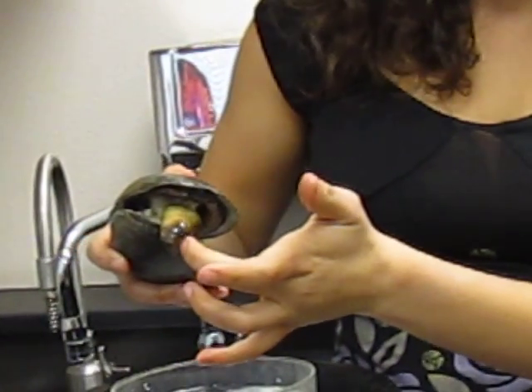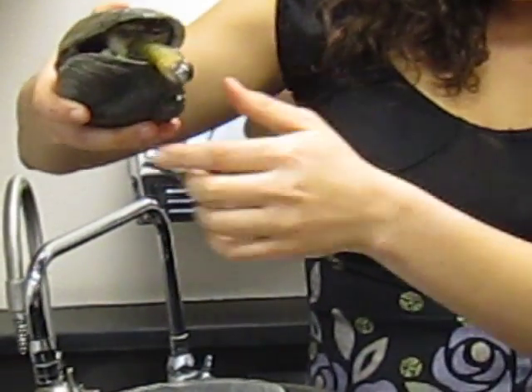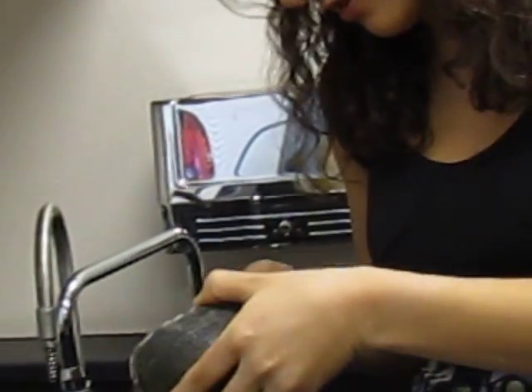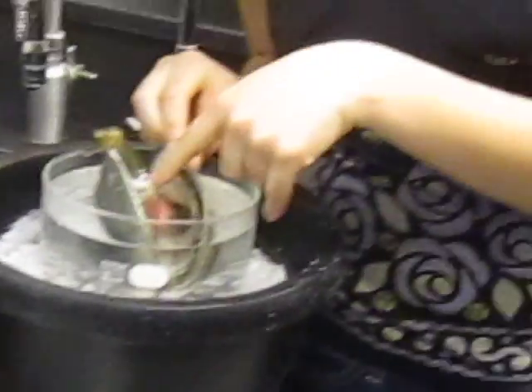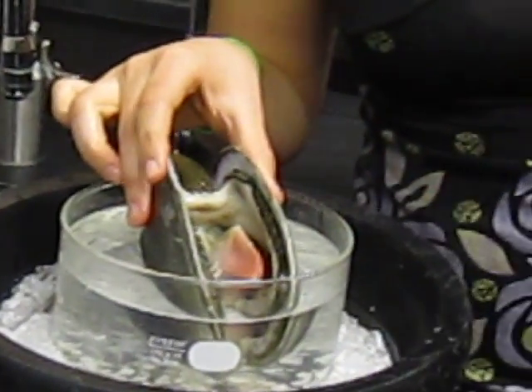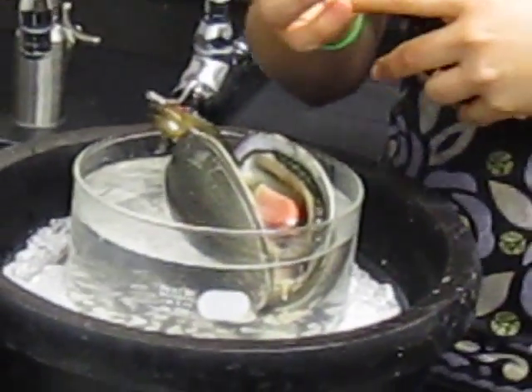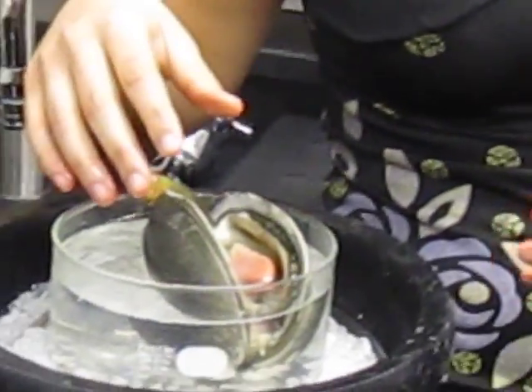So it goes in through the incurrent siphon, which is on which end? Ventral. Good. So it goes in, it'll enter the mantle cavity, and in the mantle cavity we have very important structures called, come closer, gills. You can see them in here. Yeah, so see these white flaps in here? They're kind of ridged. If you look really close, you'll be able to see that they have ridges. Really microscopically, they have little cilia that are used in creating more surface area. So more surface area for gas exchange, which is important.